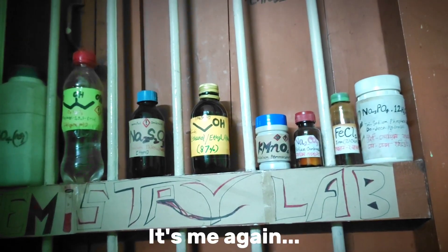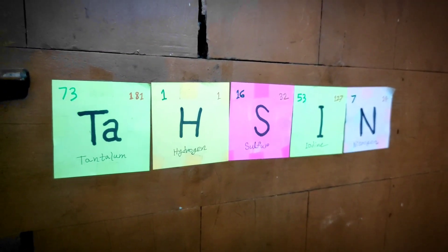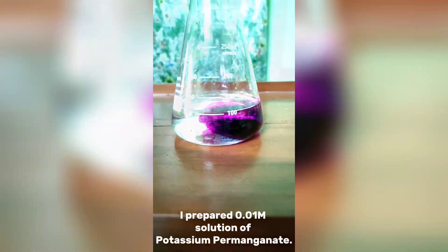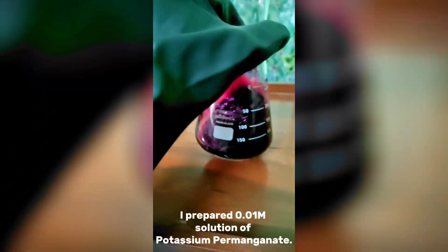Hello everyone, it's me again, Dashi Nilam. In my previous video, I prepared 0.01 molar solution of potassium permanganate.